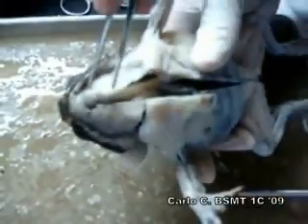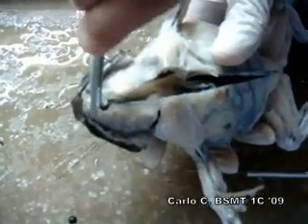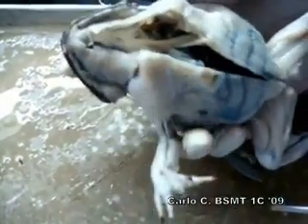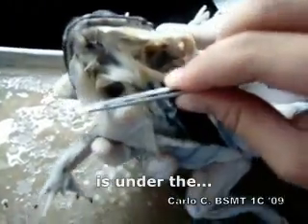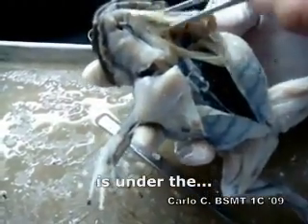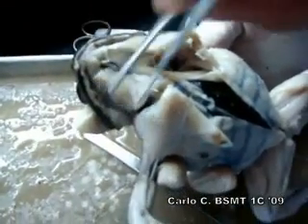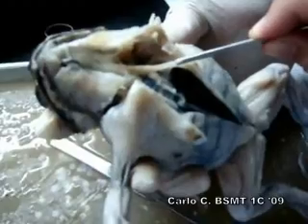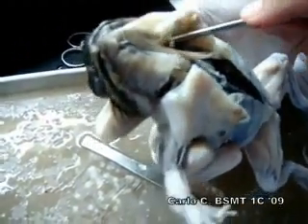The submental is the bulge found in the pre-maxillary part. It's just under the mylohyoid. The sternohyoid is this one. The omohyoid is the one across from this one.